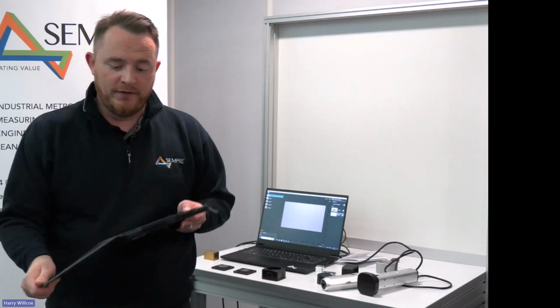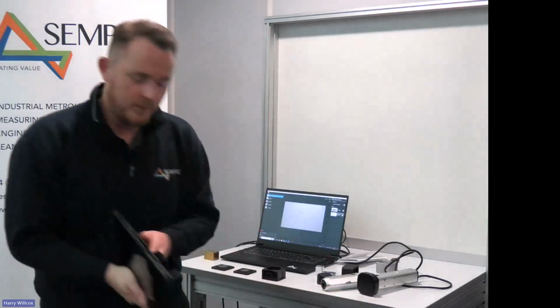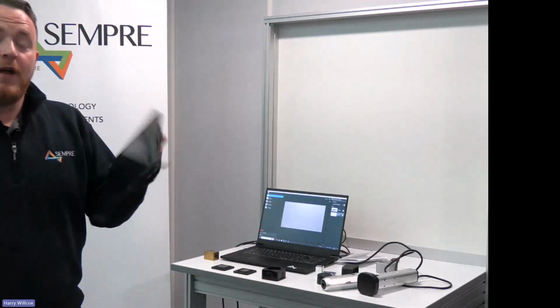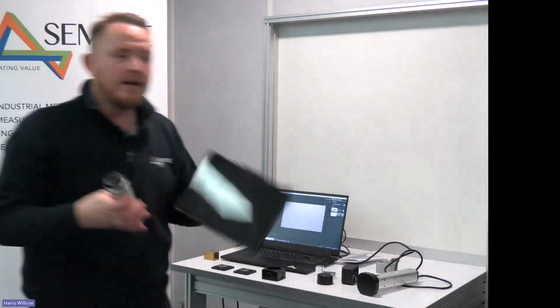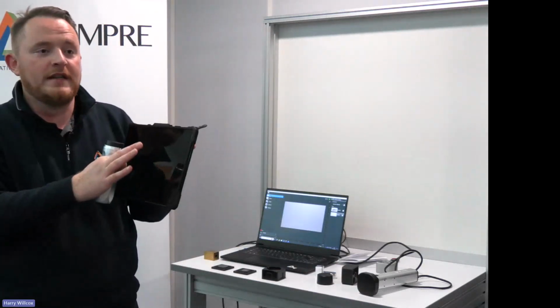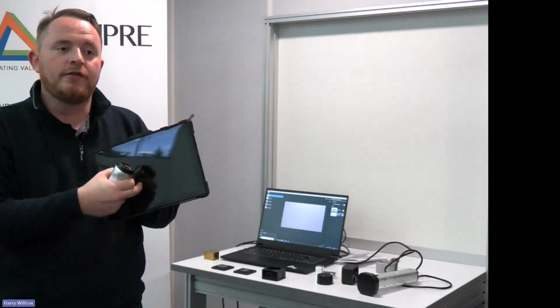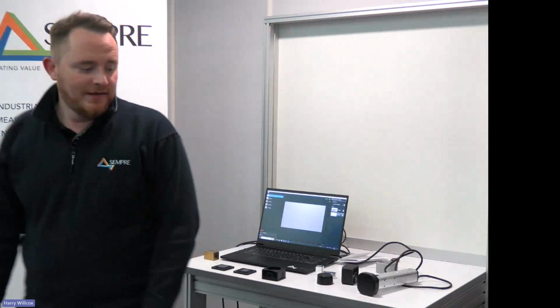The principle being, we've got a detachable keyboard. So I can take that off, place that on the floor, so I've got a tablet here. I could attach the Gelsight unit, and I could have both of them running. I've obviously not got the cable on my Series 2, but we can go and do our analysis, and this is all touchscreen based. So all of those profiles that I've been doing with my mouse, we can do on the touchscreen. Deciding the area, the field of view, etc., we can do on our tablet. So everything comes within the kit, and it's a key part of the system.